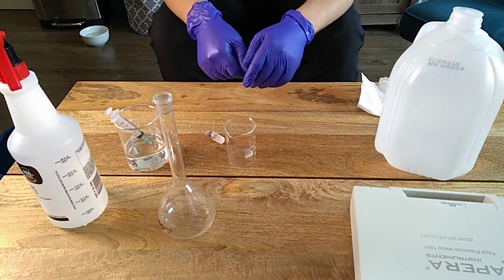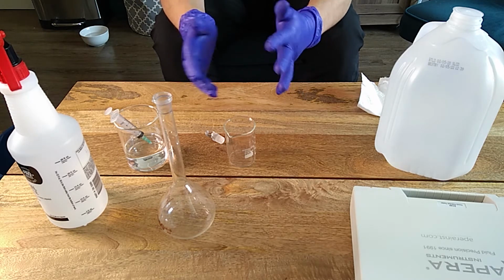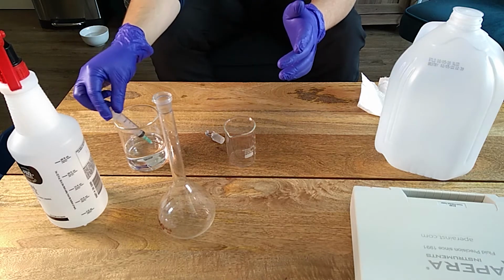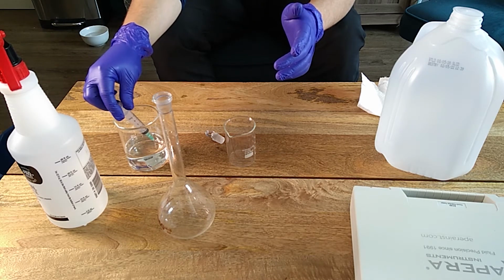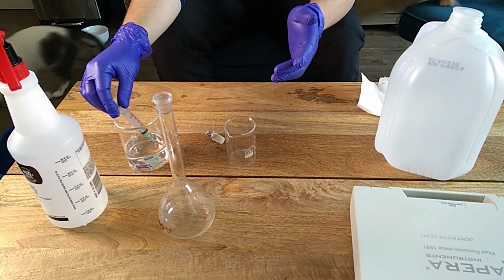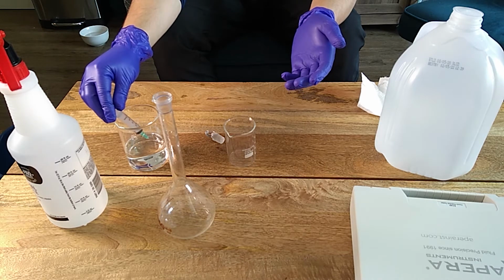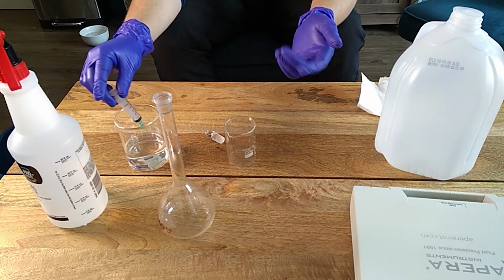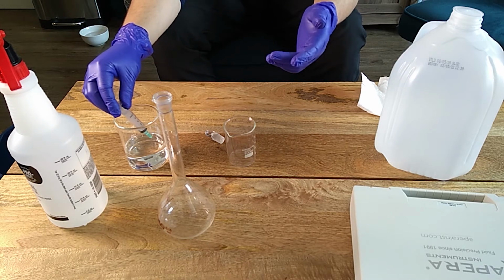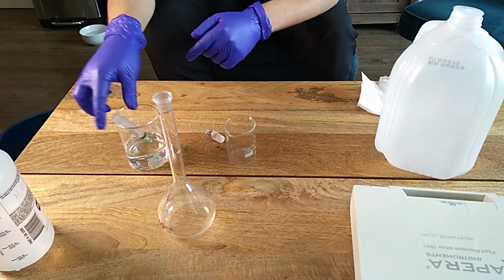To transfer small volumes, you can use pipettes. That's the standard lab thing. I generally don't use pipettes when I'm doing things at home or for growers. I generally like to use syringes because they're easier to get. Sometimes you're in a hurry and you need accurate volumetric material, and pipettes are not available everywhere, but syringes you can get at any pharmacy, so they're often very cheap and easy to have. I'm going to show you how to accurately measure a small amount of volume using this.